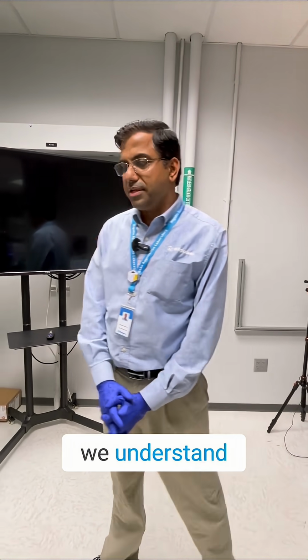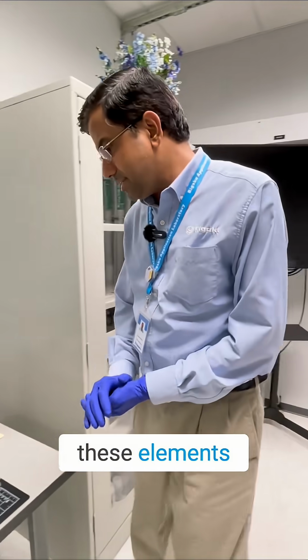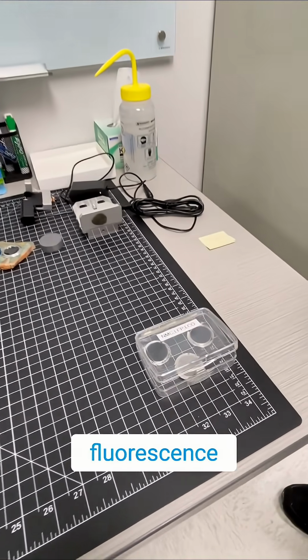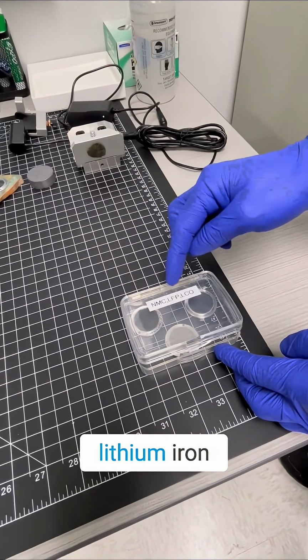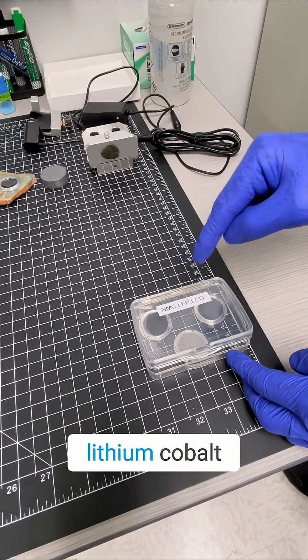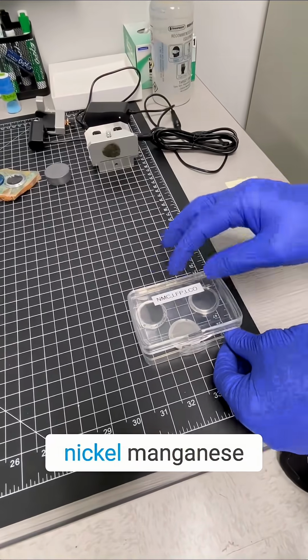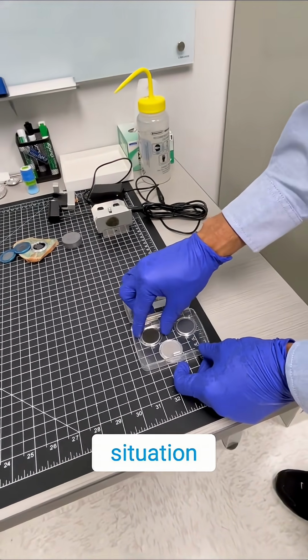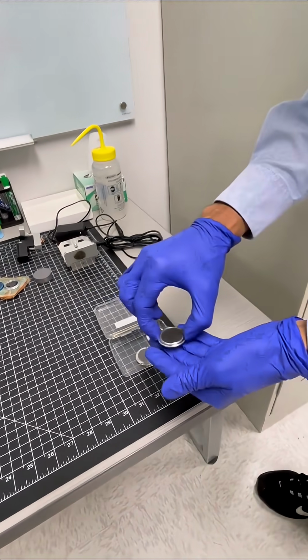Show me how to measure cobalt containing samples on the MiniFlex? Sure, Aya. We understand some of these elements, such as nickel, manganese, cobalt, have high fluorescence. NMC, LFP, lithium iron phosphate, nickel manganese cobalt, lithium cobalt oxide. Let's choose the nickel manganese cobalt sample, which in an ordinary situation can have very high fluorescence.